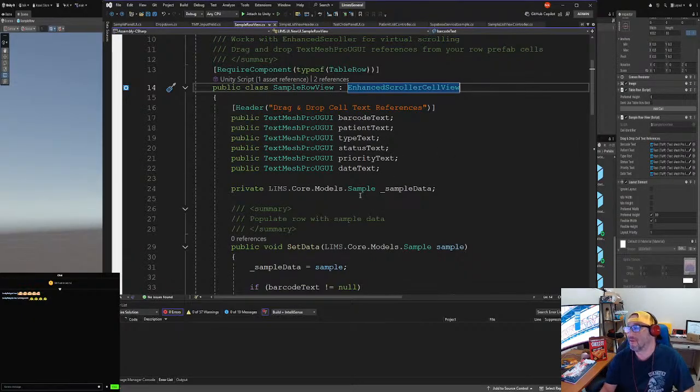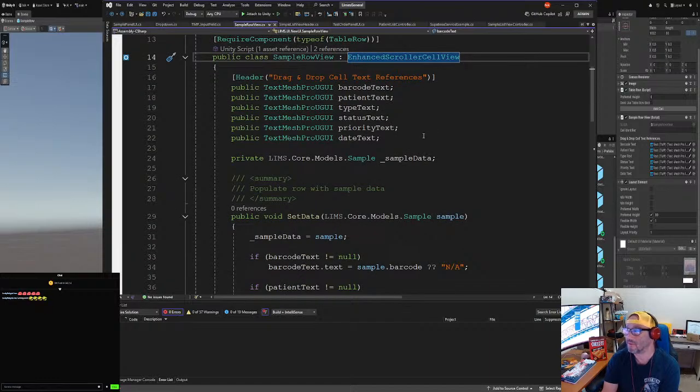The only problem, which we're going to fix later down the line in this series, is this. Now, if you want this to be dynamic, we can. We could do an array of this stuff, but you still need to assign it manually, or we could do it all dynamically. But oftentimes in databases, you don't want to expose all of the columns. It takes up a lot of memory, and you may not want to expose those columns. So you will build out a system where you tell it what columns you want to expose and display.